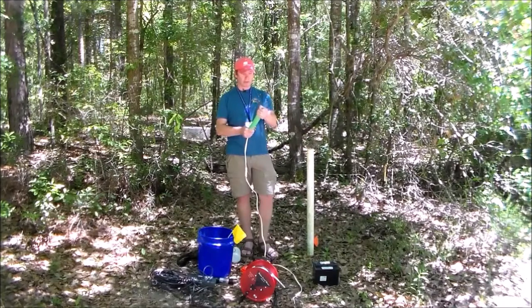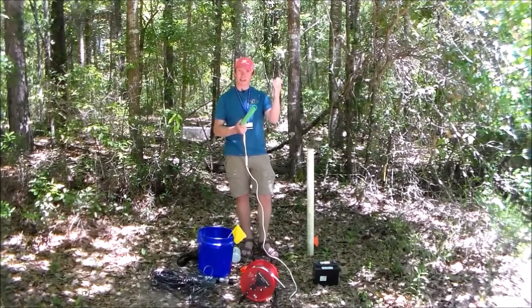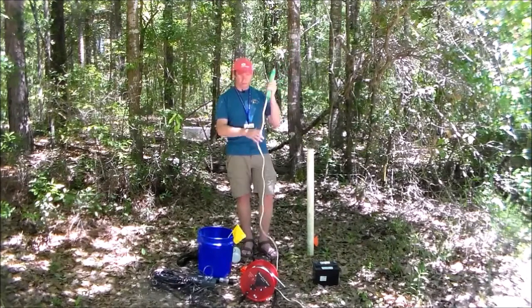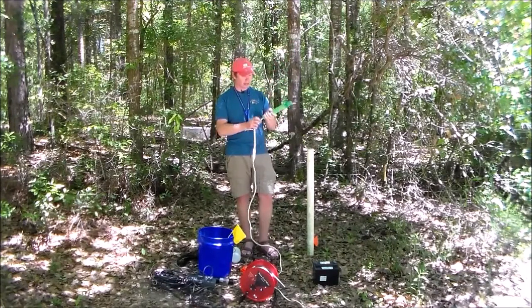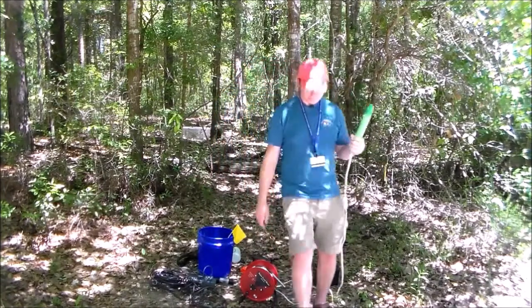This is just a really, really simple pump. I mean, it's about as simple as it gets. There's just a small turbine in the bottom of this, a little screen to keep sand from coming in. This is DC powered, so it's 12 volts. It hooks up to a car battery, and I've got some alligator clips over there. And on the other side, of course, I need my hose.